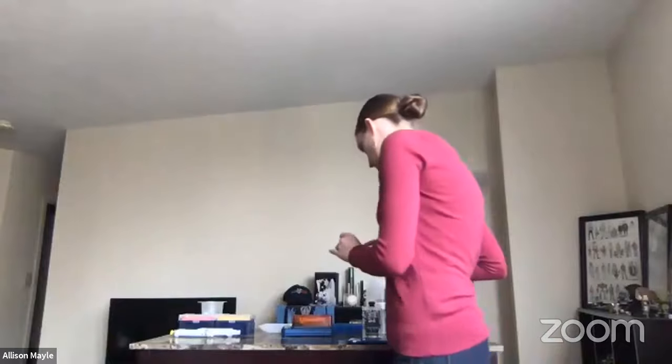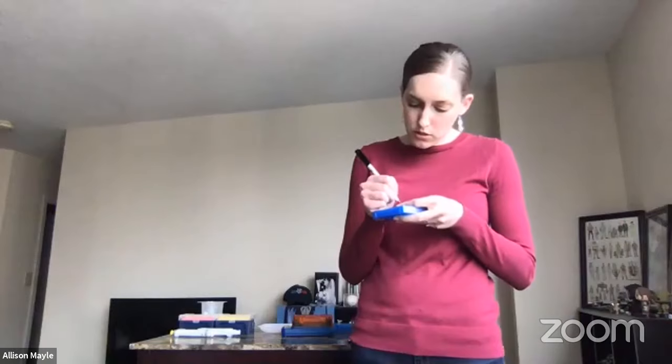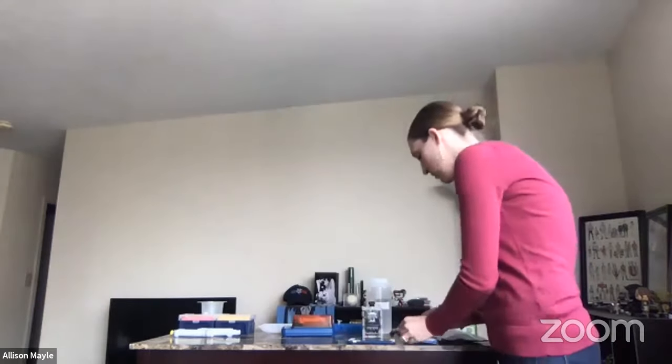I'll try to hold them up here — you can see it's kind of got a yellowy-orange color. The pH indicator is that sort of orange color. I'm going to do two different reactions, just like Dr. Pepinella did so that we can carry on with a similar experiment. She already completed hers and I'm going to show you her results. I'm going to first label my tubes so I know which one is my plant and which one is my invertebrate.